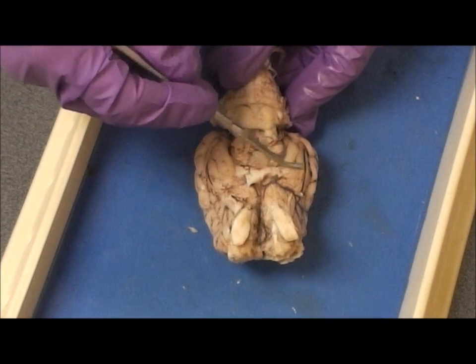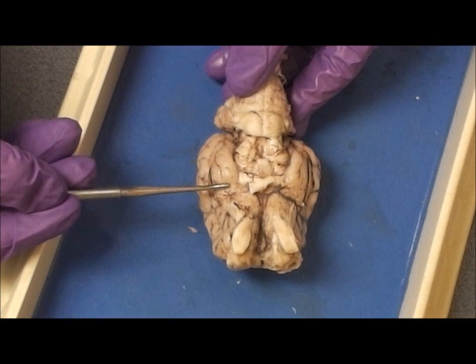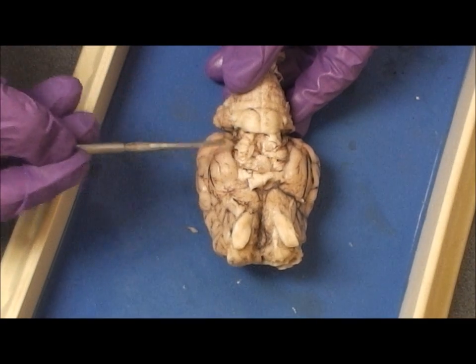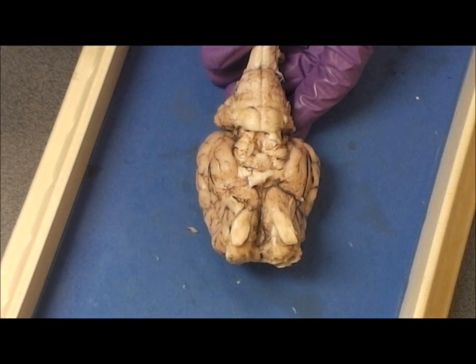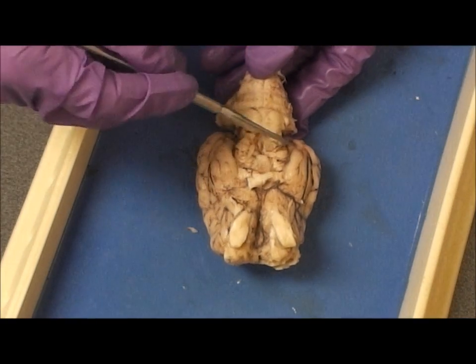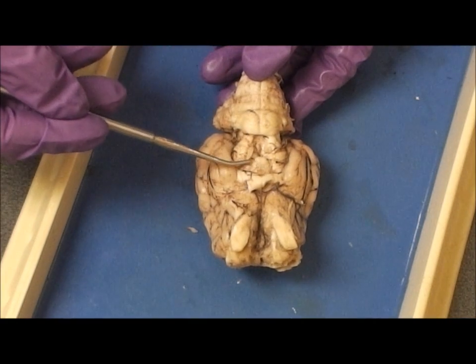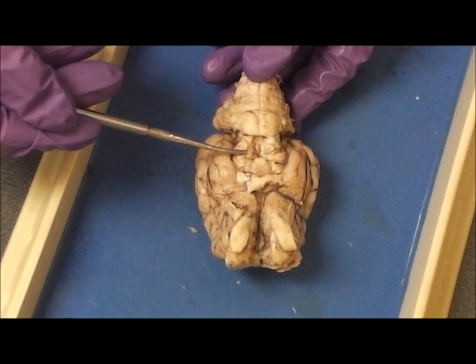You'll notice this smooth part of the cortex on the ventral side of the brain — that's the piriform cortex. This part of the brain is the midbrain, and here's cranial nerve three.